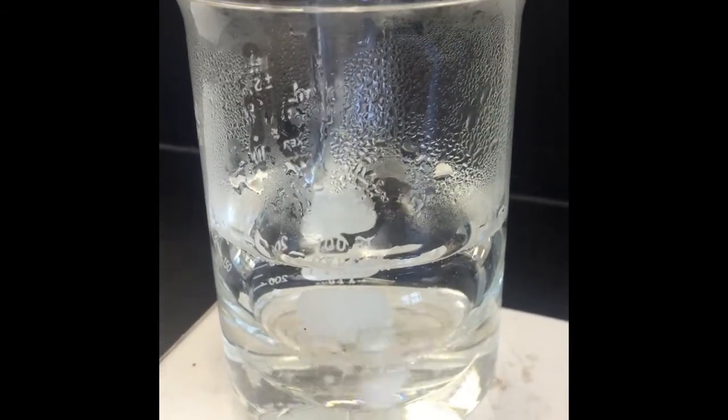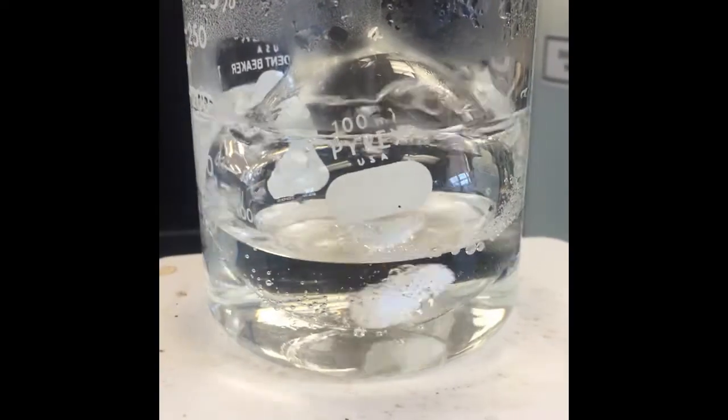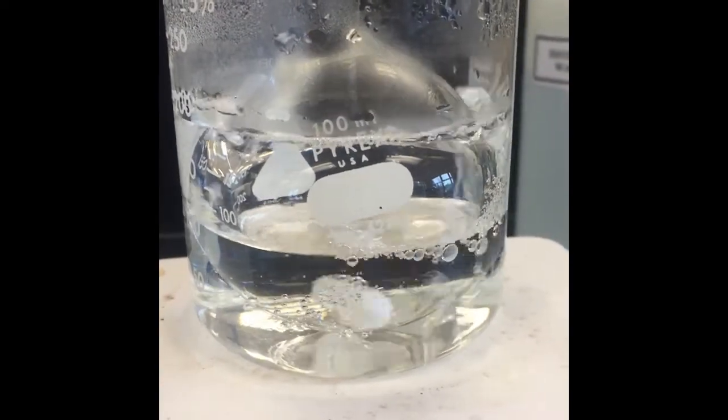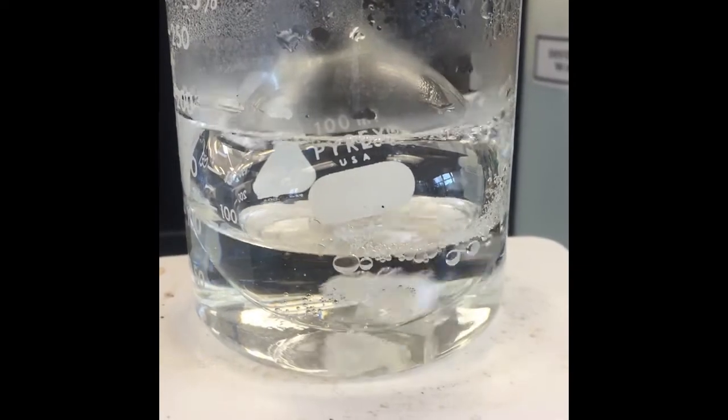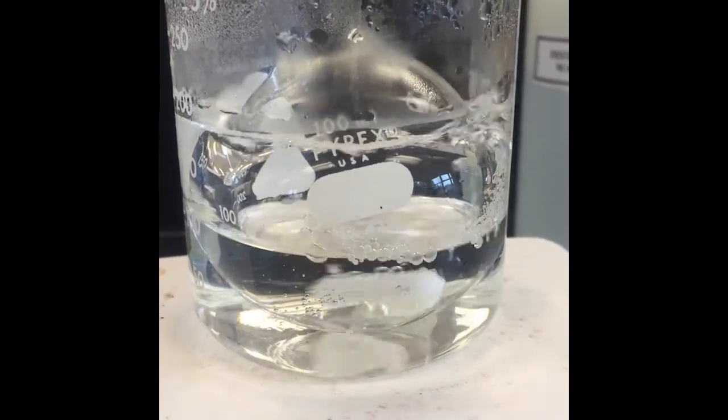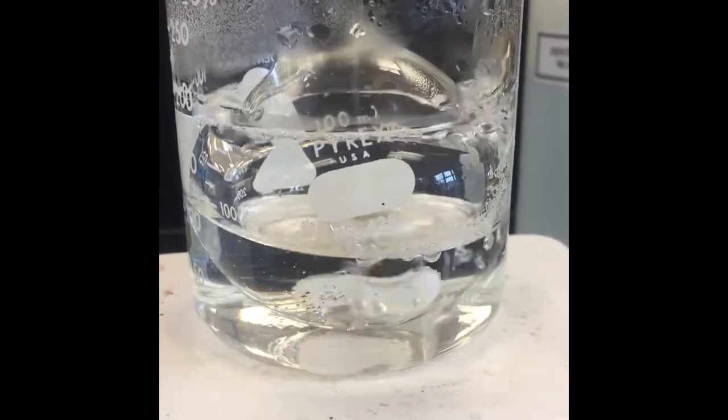After just a couple of minutes in the boiling water bath everything is dissolved. So now we'll stir that for another 23 minutes.